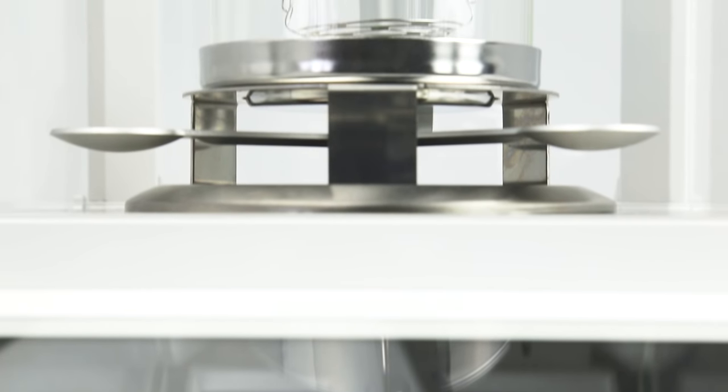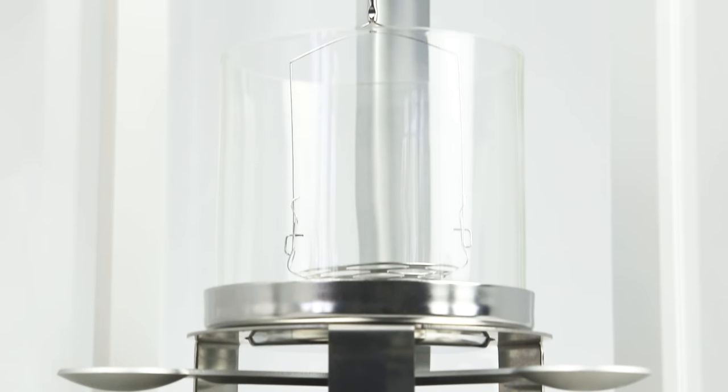A dedicated density kit can be mounted on your Mettler Toledo analytical or precision balance in just a few simple steps.